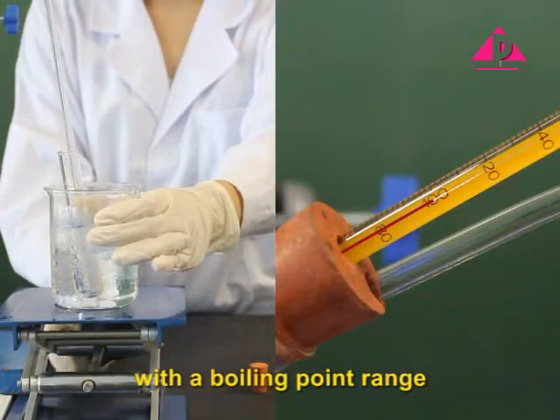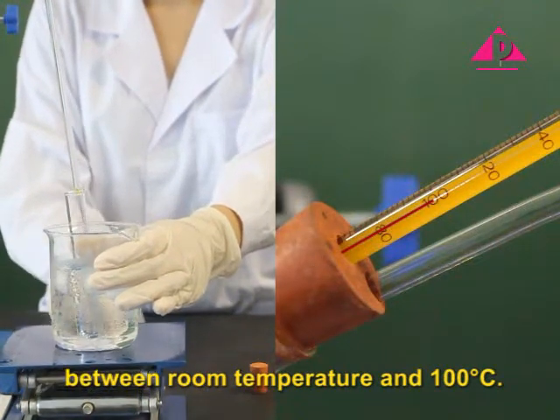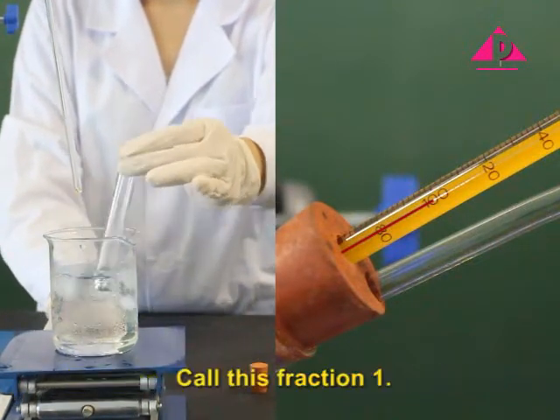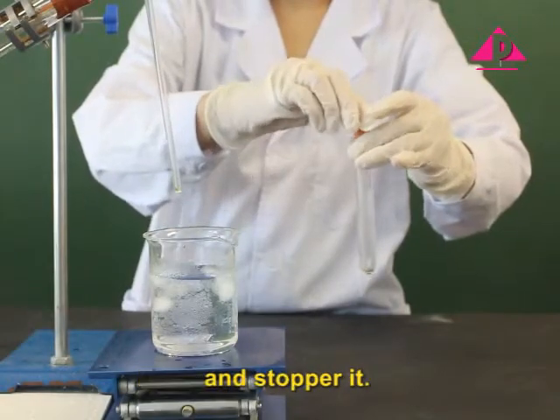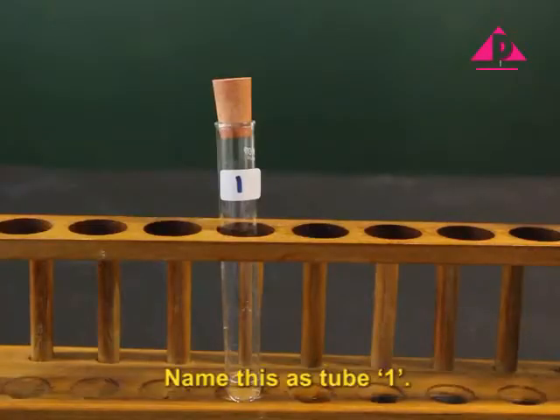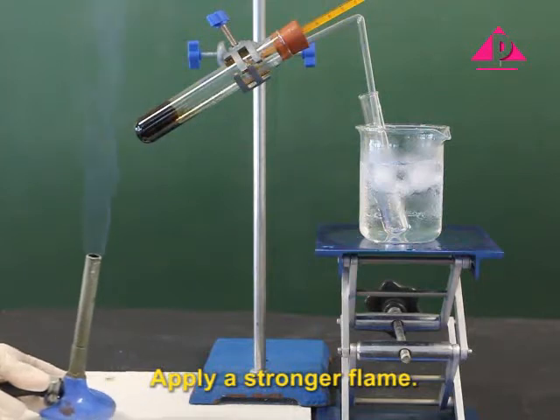Collect the distillate with a boiling point range between room temperature and 100 degrees Celsius. Call this fraction 1. Remove the receiver tube and stopper it. Name this as tube 1. Apply a stronger flame.